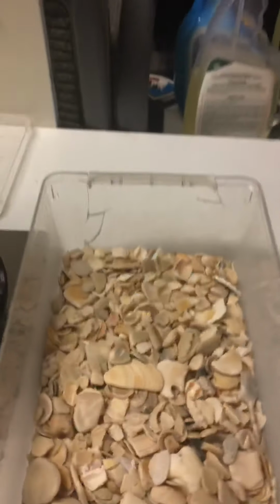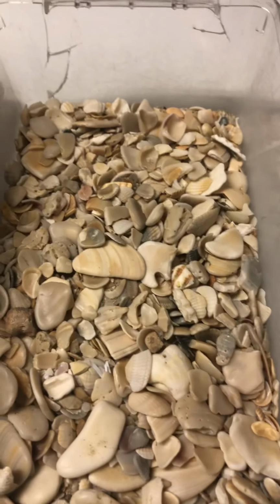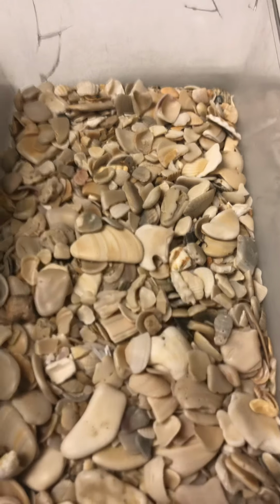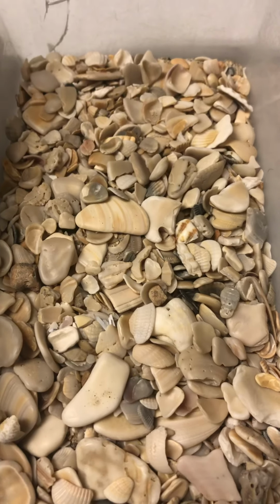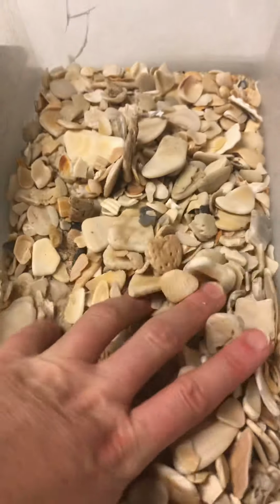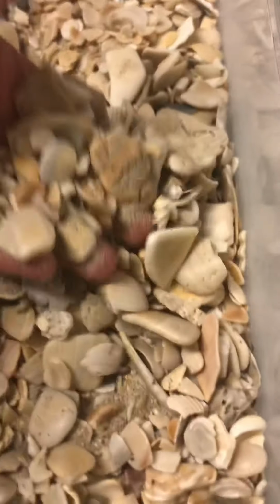And let's have a look at our sand sample. This is from a Texas beach. It's actually from Little Shell Beach, the same beach that you will look at some sand from in 9.2. At first glance, the sand looks like it's all just large shell fragments. But if you take a look a little closer down into the sand, you can see some much finer fragments in here.